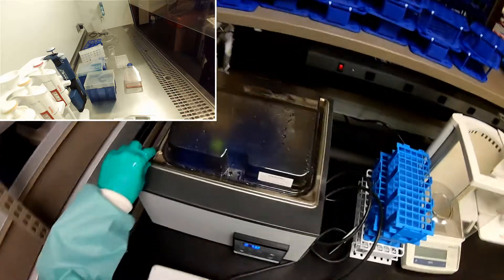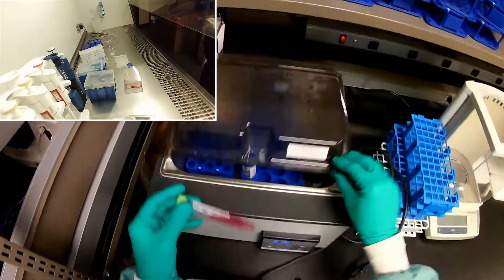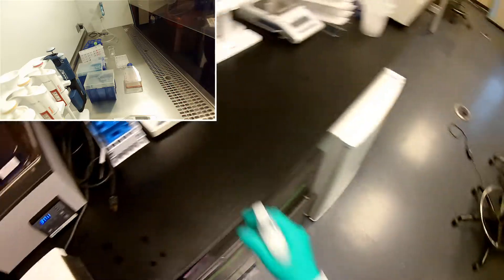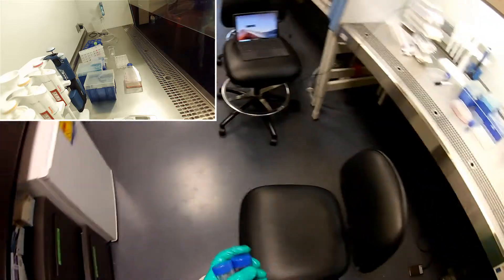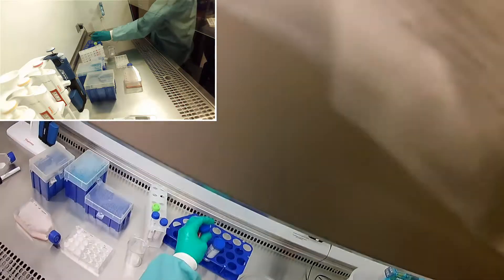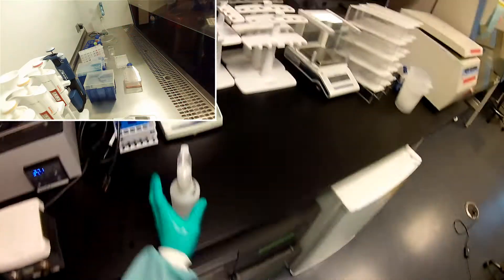First things first, I'm going to get the trypsin, media, and PBS out. Yes, we're melted on the trypsin. Remember, I like to spray these really well because it comes out of the possibly nasty water. Spray off my hands.